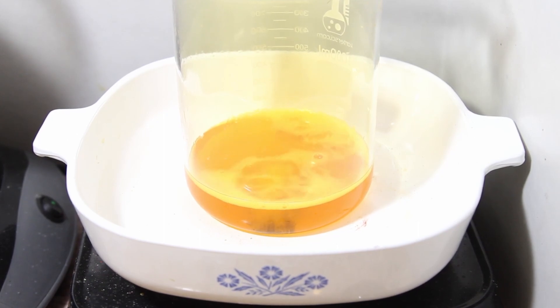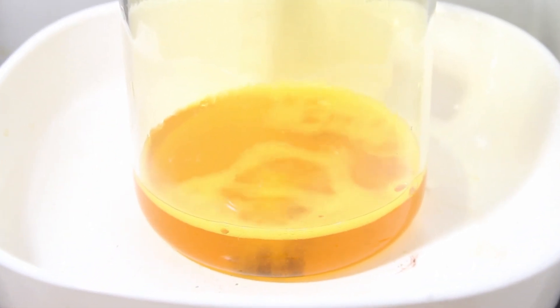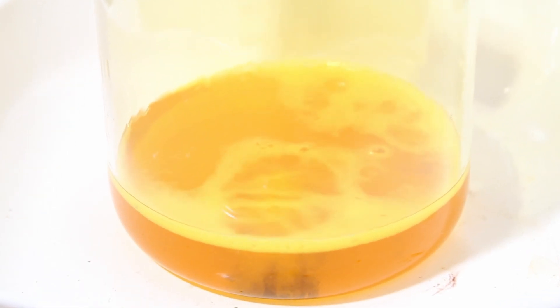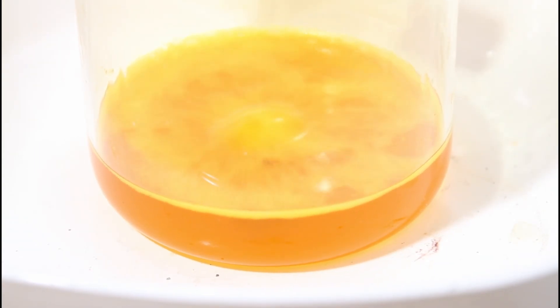I had some gold filings left over from a piece I was working on and I didn't want to just throw them in the stock pot, so I cleaned them up quick with aquaregia. Here I dissolved them over maybe ten minutes, this is fast forward a little bit. Everything's gone into the solution and it's cleared up quite nicely.